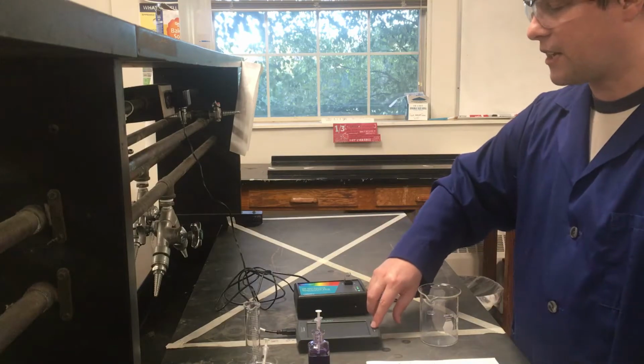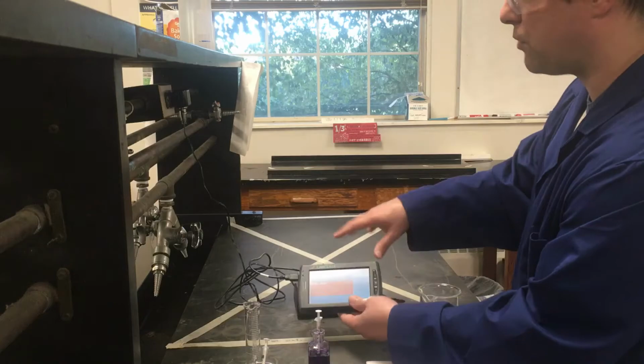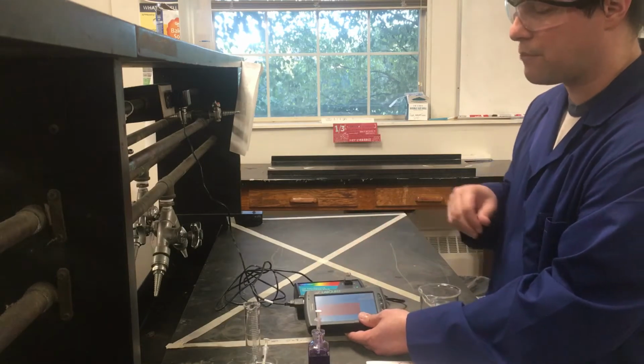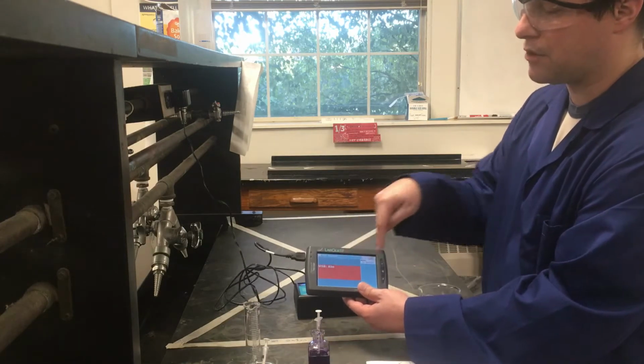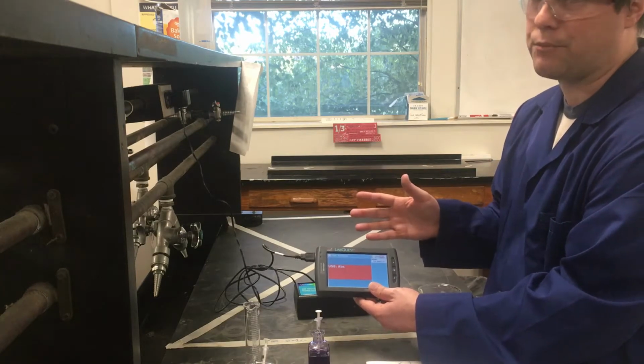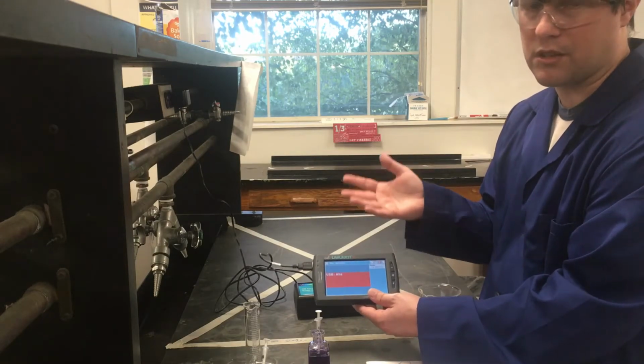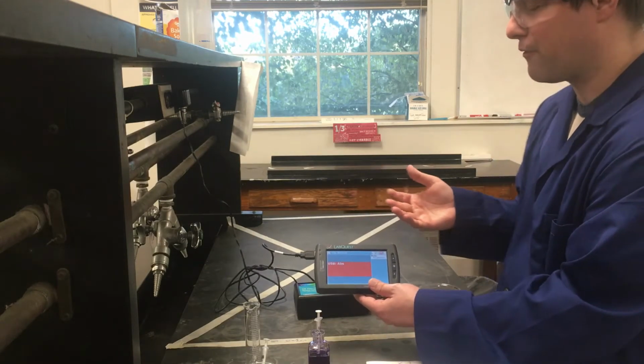In terms of setup for our spectrophotometer, a couple of things here. When you first plug in our spectrophotometer to a LabQuest, you should see a menu that pops up with a little red box that says USB and absorbance. If it doesn't happen, we'll probably have to get you a different spectrophotometer or a different LabQuest, because there are sometimes some communication issues between them, unfortunately.